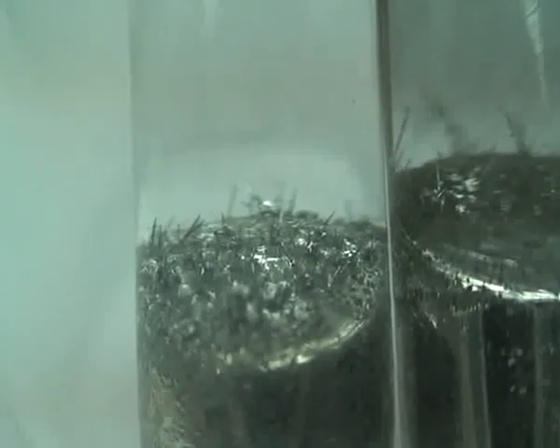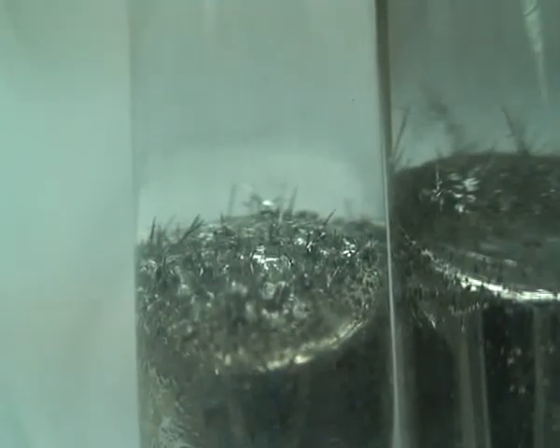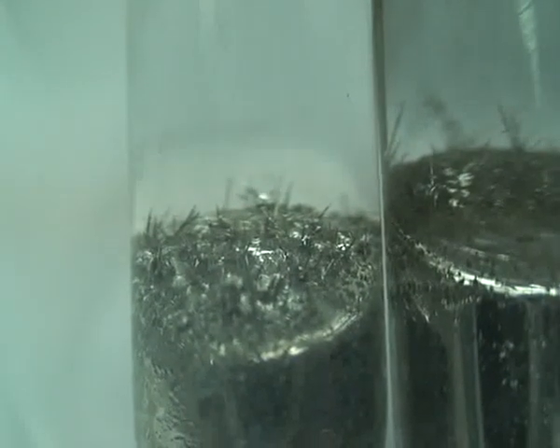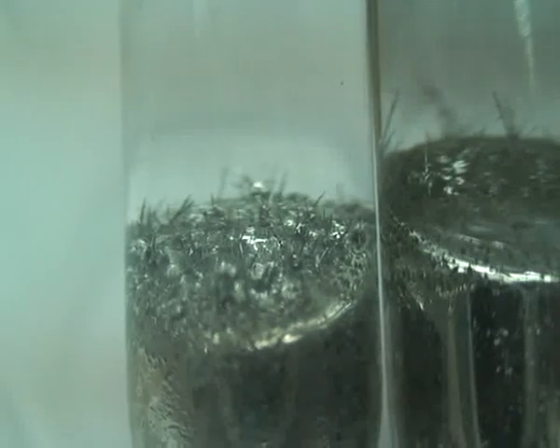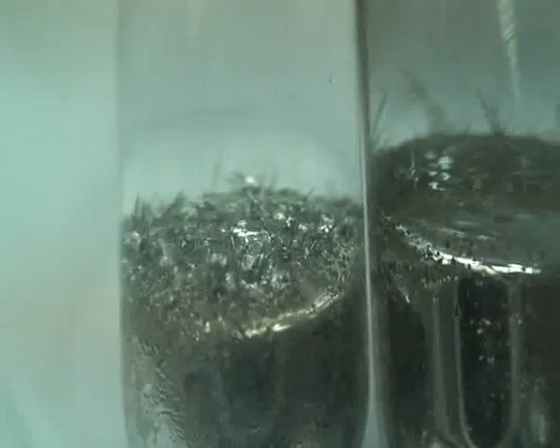the silver appears as very shiny crystals on the curved meniscus of mercury.